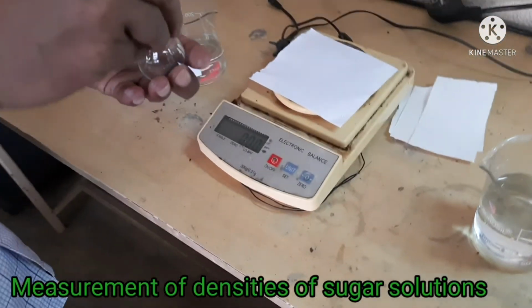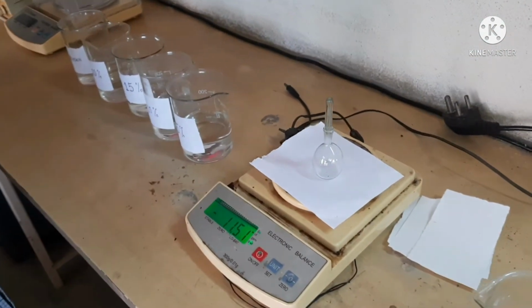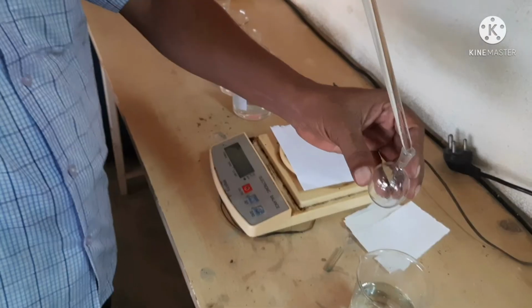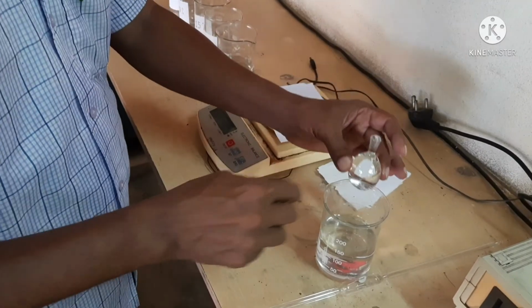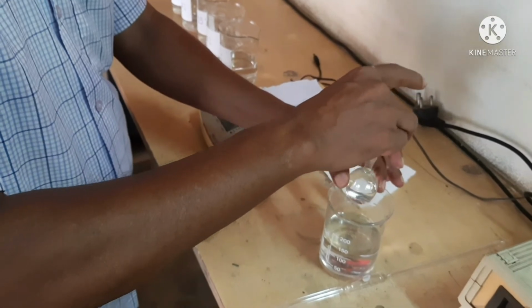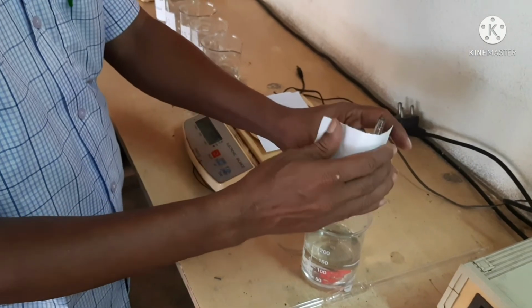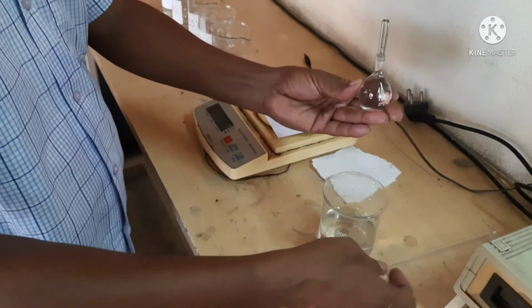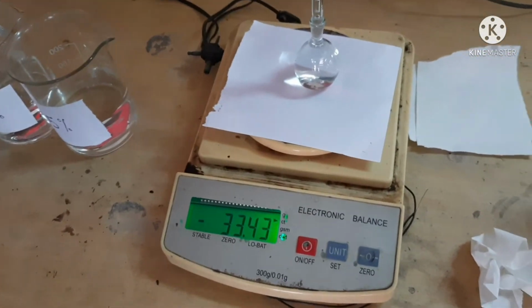At first, we measure the weight of the empty specific gravity bottle with lid, and the weight is 11.51 gram. Now we fill the bottle with water, place the lid and wipe out excess water present on the outer side of the bottle, and then measure the weight. The weight is 33.43 gram.